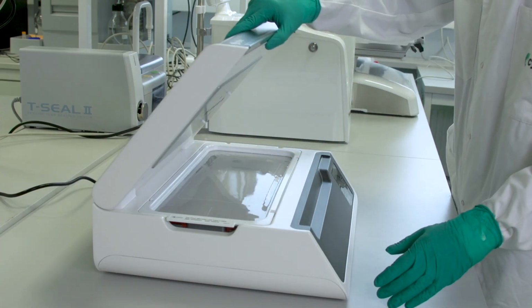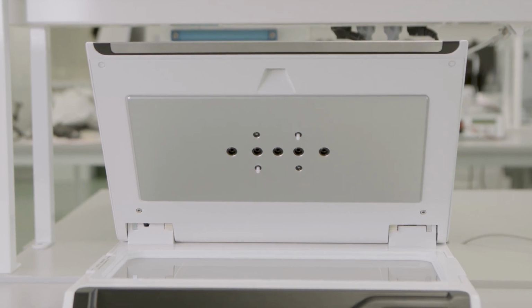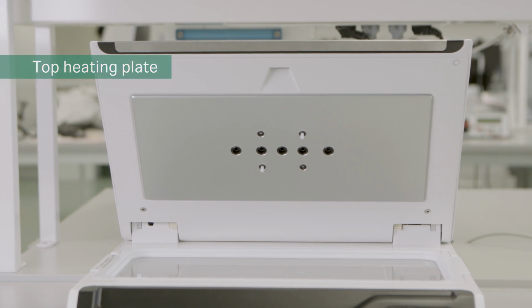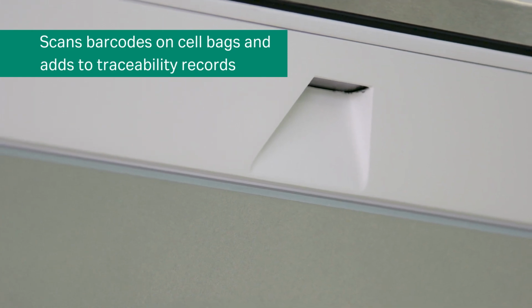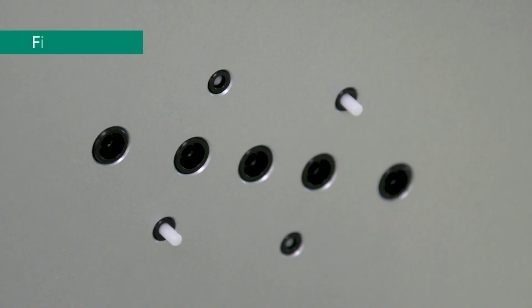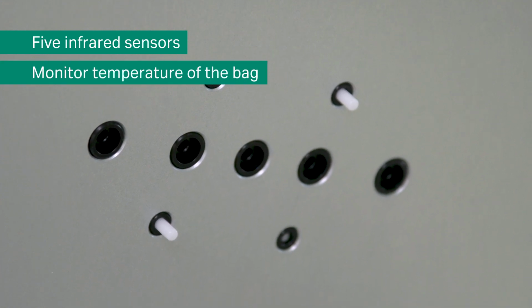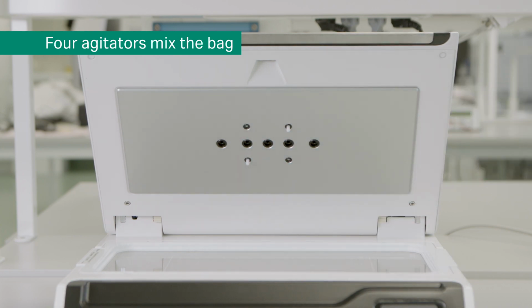Use the handle to open. There are some key features within the lid designed to assist in the thawing process. Here is the top heating plate. This is the barcode scanner, designed to read any barcode present on the cryo bag and add it to traceability records. Here you also have the option to take an image of the bag post-thawing. There are 5 infrared sensors used to monitor the temperature of the bag during thawing. These are the 4 agitators used to mix the content of the bag.